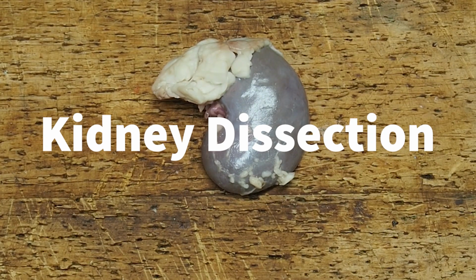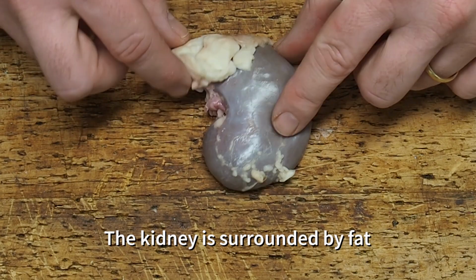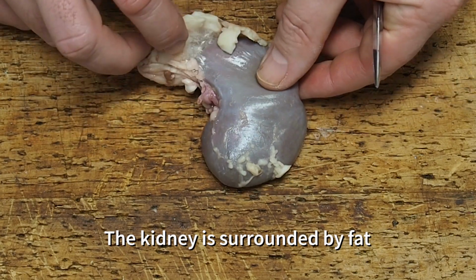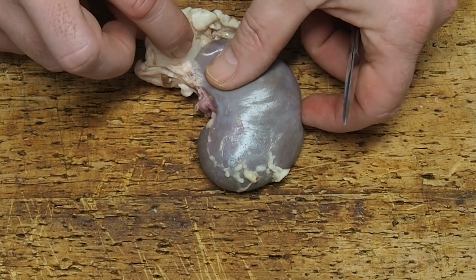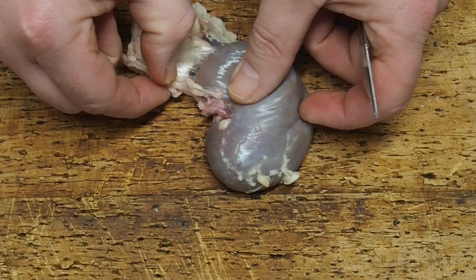Welcome to this video on the kidney dissection. This is a sheep kidney, which we use for its similarity to human organs. You can see that it's surrounded by a fair amount of fat and then a kind of whitish membrane around the outside called the capsule. And I'm just removing the fat here to expose the kidney proper.